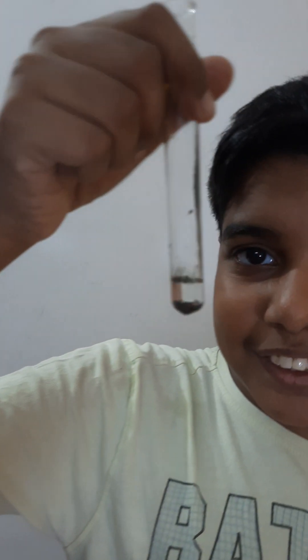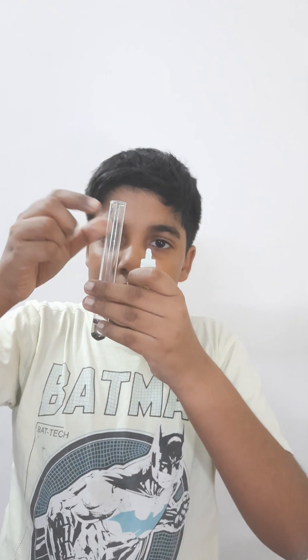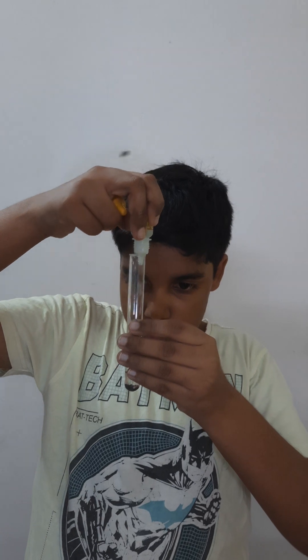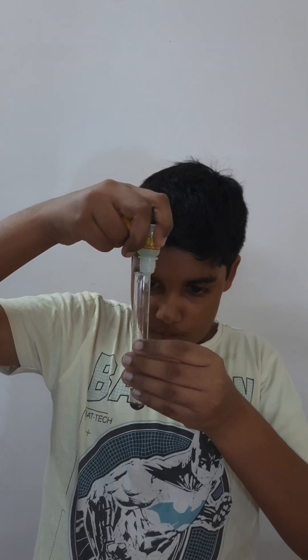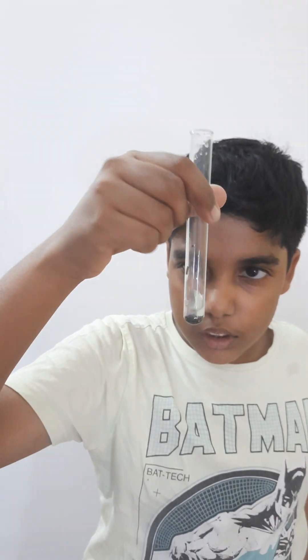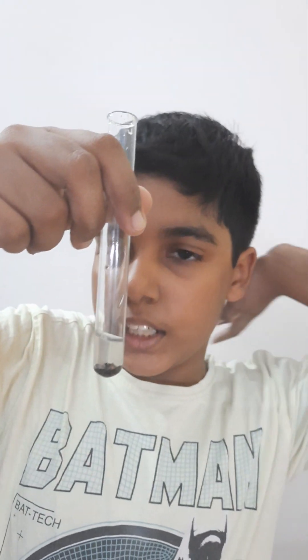We have mixed some quantity of iron filings inside this test tube. Now we're going to mix some copper sulfate into this iron filings. We'll mix it in and show you the results — it should produce a pale greenish color.